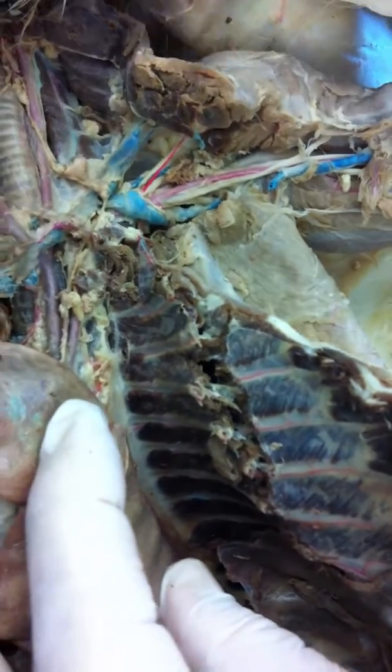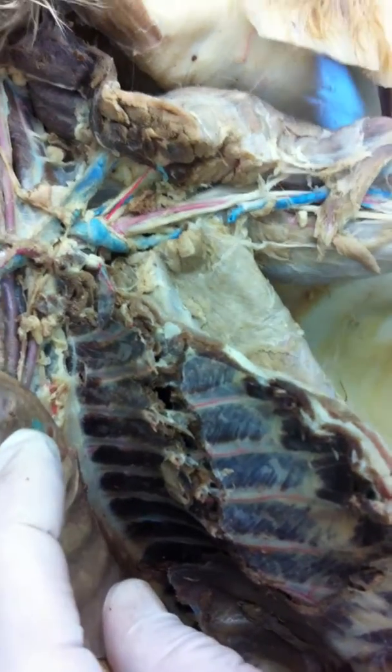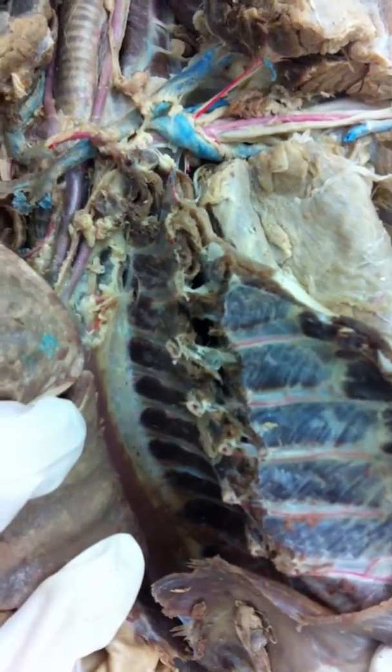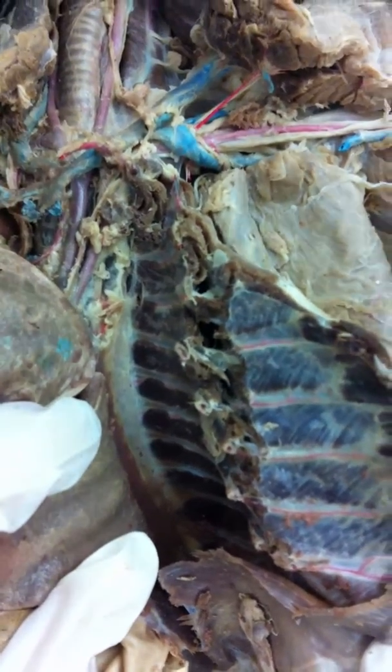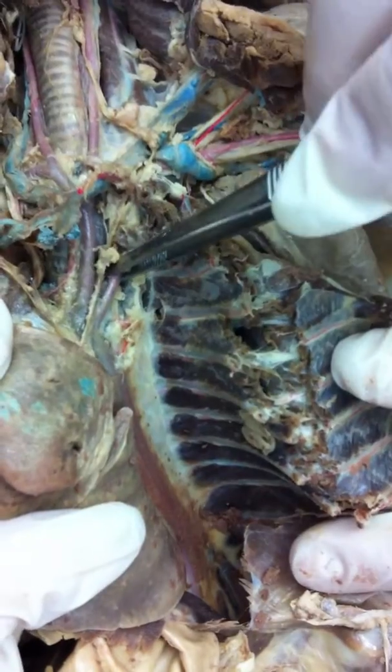Well, the arch is technically where it's curving, right? Is it the vena cava? No, that's veins. It's the aorta. This is thoracic aorta. You got ascending aorta, you got arch of the aorta. Then for the descending aorta, you've got descending thoracic aorta and you got descending abdominal aorta. This is the aorta, the largest artery in the body, isn't it? And we know it is because you can see the branches that we've just identified, right?